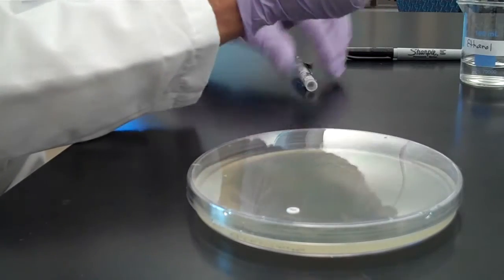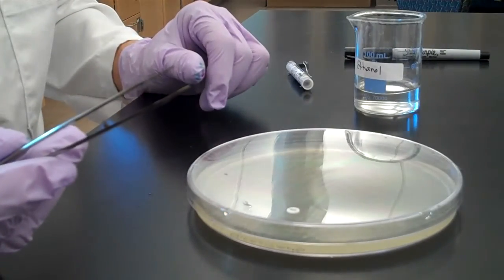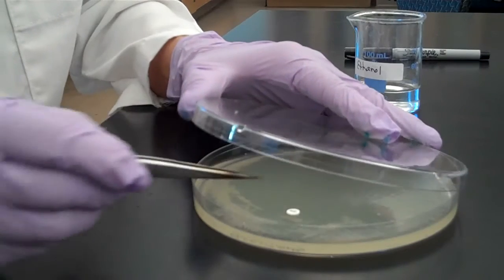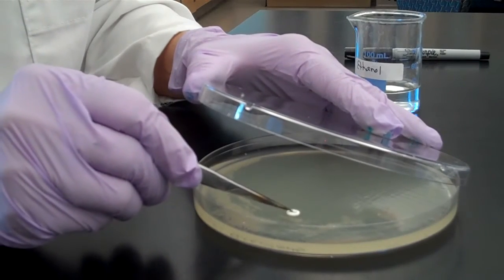Take the tweezers out of the alcohol and let the alcohol evaporate. Then using the sterile tweezers, press the disc into the media.